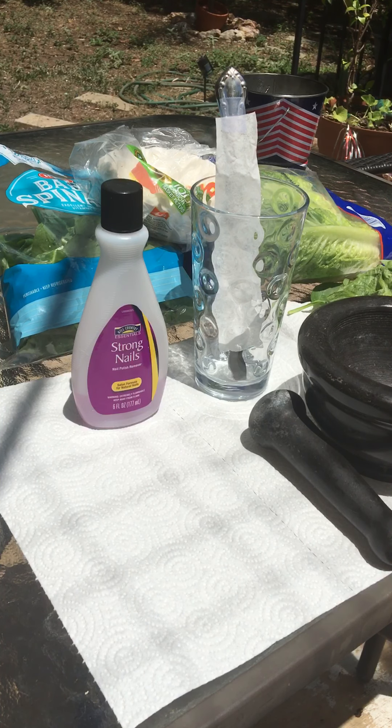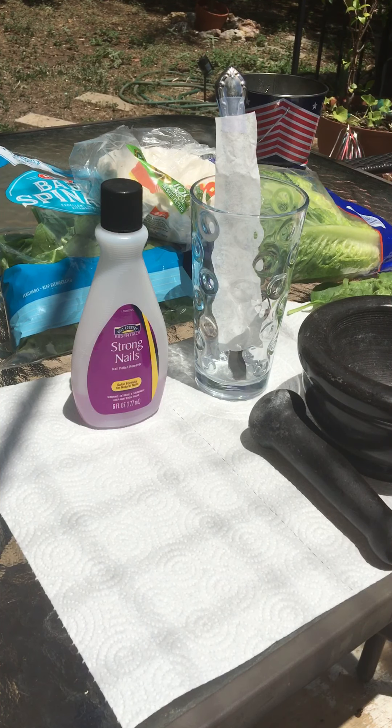Most of the time plants typically look green, however in the fall many plants change colors. The same loosely applies to algae — you have species of green algae and species of red algae, which as the name implies rely on different pigments. So we're going to go ahead and extract the pigments from some lettuce, spinach, and spearmint.